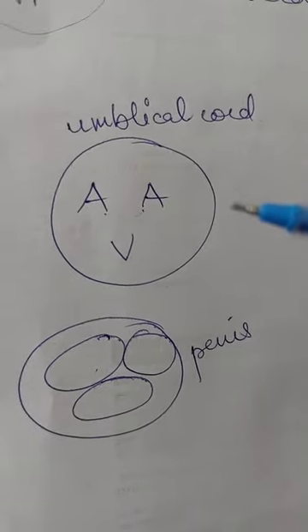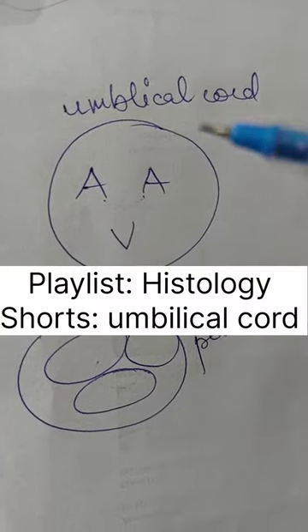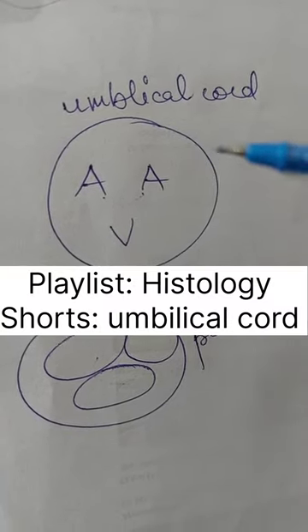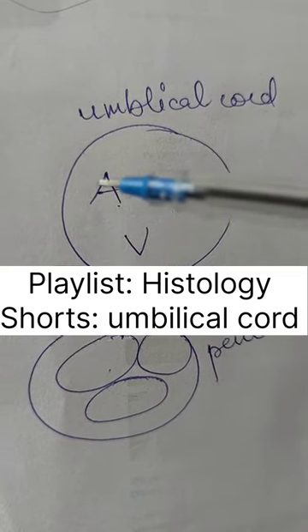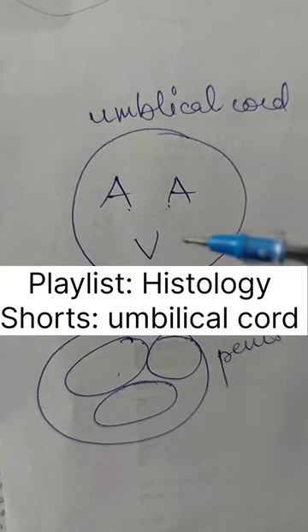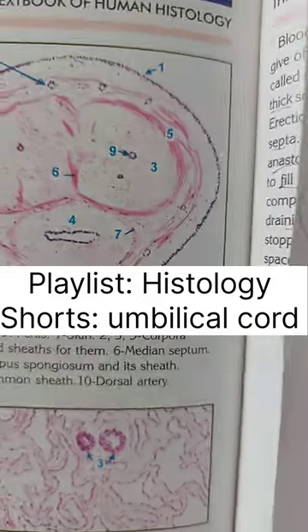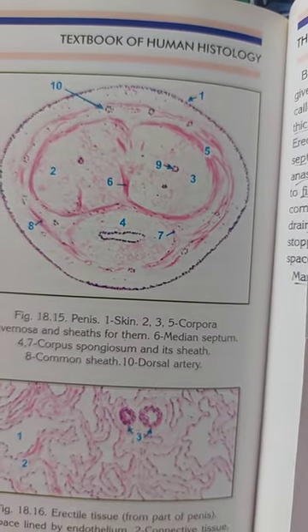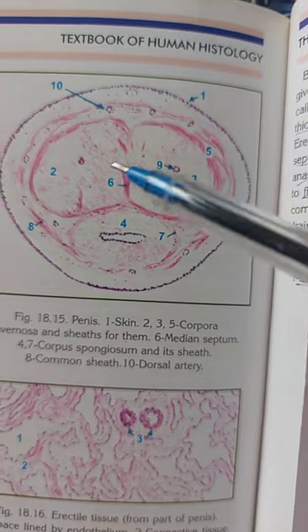If you want to check out the umbilical cord, I have a short video on my YouTube channel where the umbilical cord slide is shown and the arteries and veins are seen. And this one is the penis — so yes, these are the two structures.